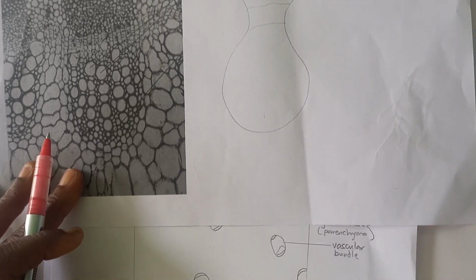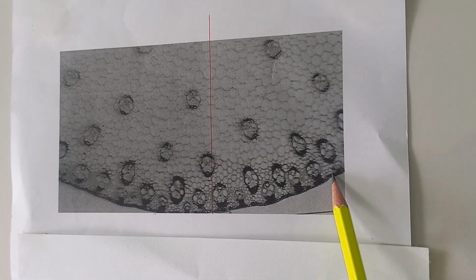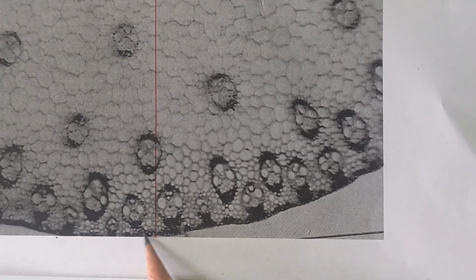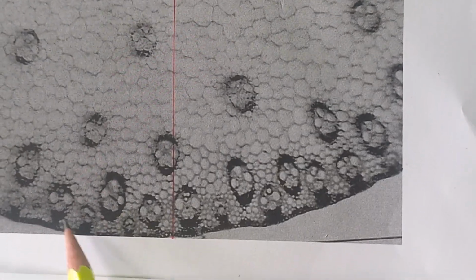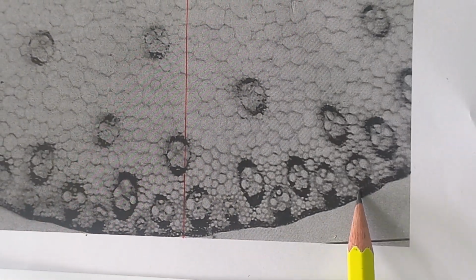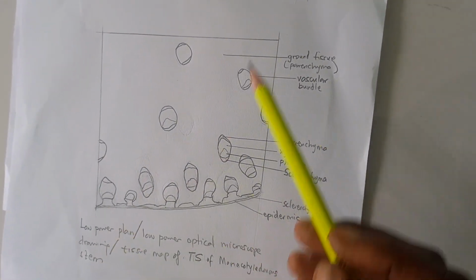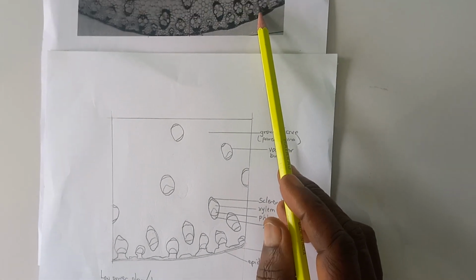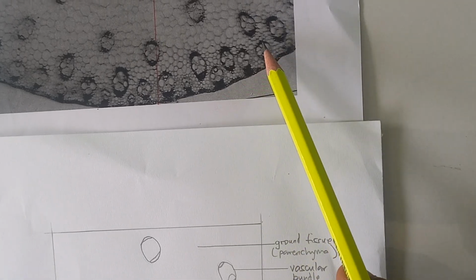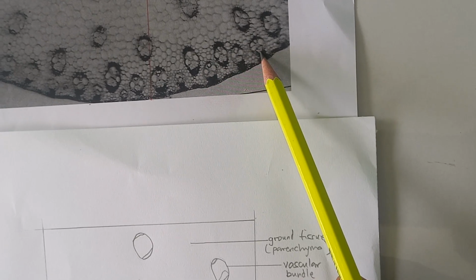What we want to say is that we come back to this, which I've already made. This one forms one tissue. Even if you can't see the cells well, you see that they are a dark area, and that represents sclerenchyma, forming one tissue. So those tissues have been drawn in. If you look at this one, that seems to form one area. There is this that forms a tissue. There's this area that forms one clear tissue.